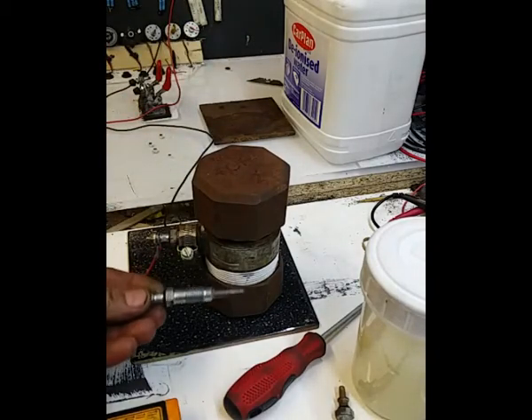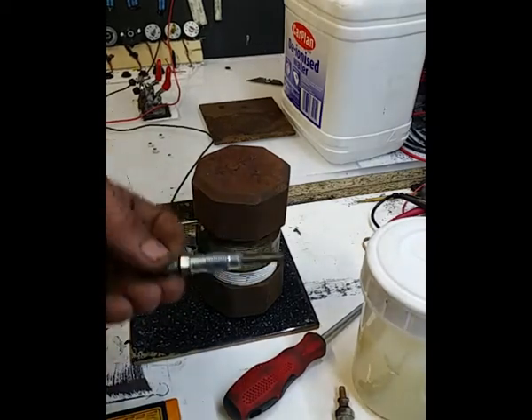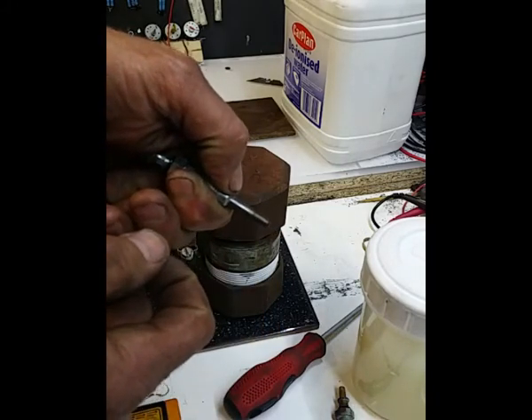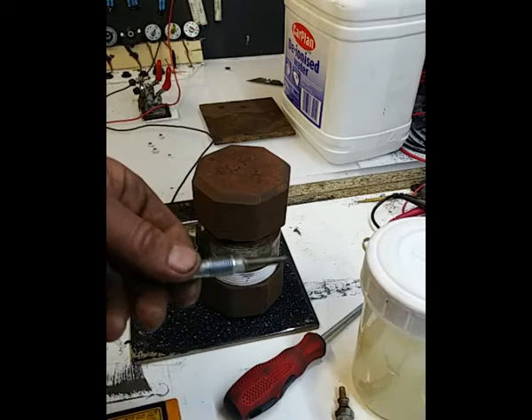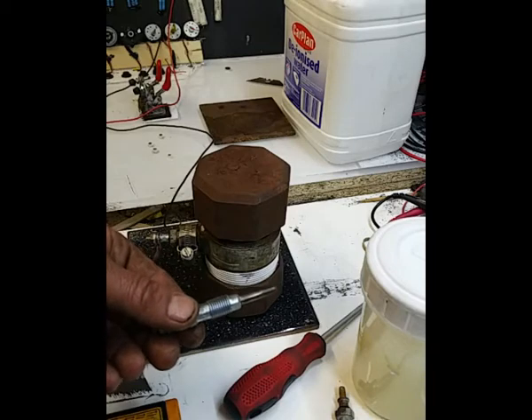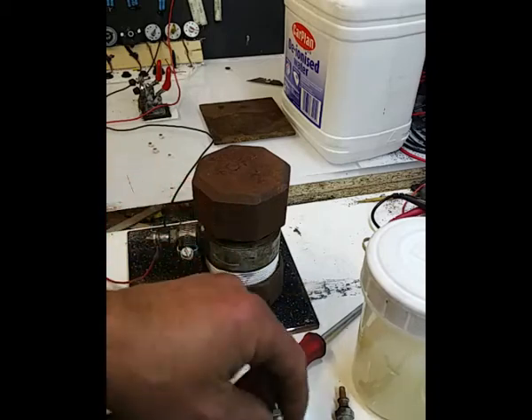So there we go, one glow plug, a diesel glow plug, heater element, call it whatever you like. Now these things are used to some serious temperatures inside of the internal combustion engine, because that bit there is continuously in that combustion chamber. Maybe not all of it, maybe just a bit of it, but it's there. Now, I hate to think what temperatures you've got inside of a combustion engine when you're doing like 70 mile an hour for 3 hours or 4 hours. That thing there has got to put up with that permanent temperature. So as a heating element, it's got to be good, I assume.